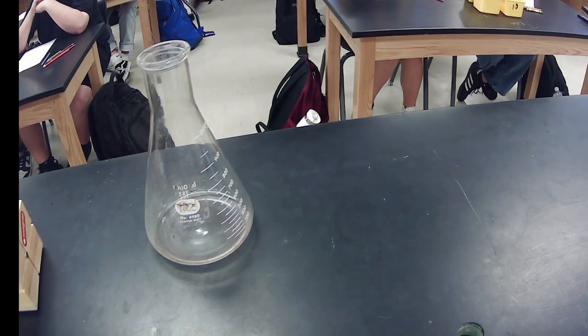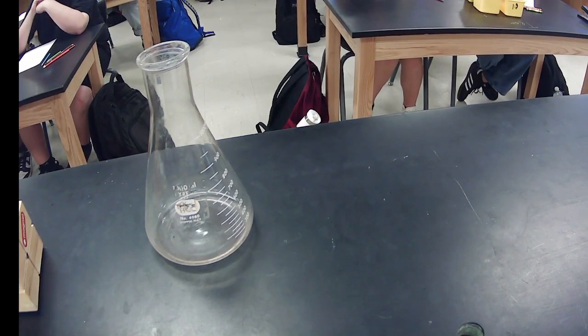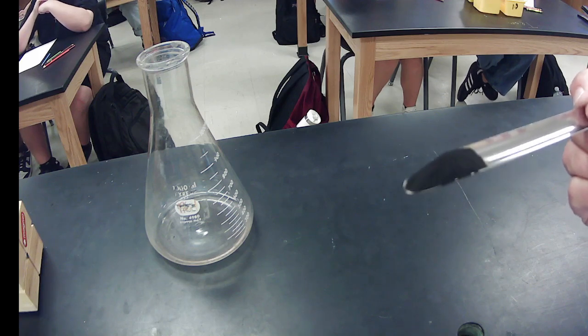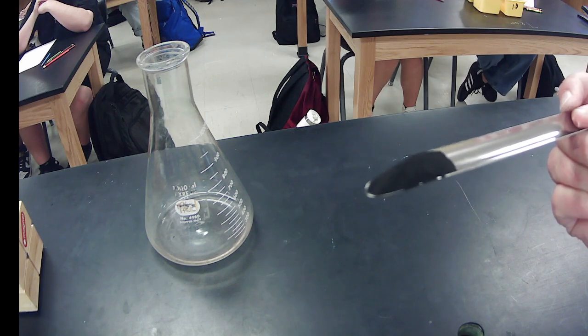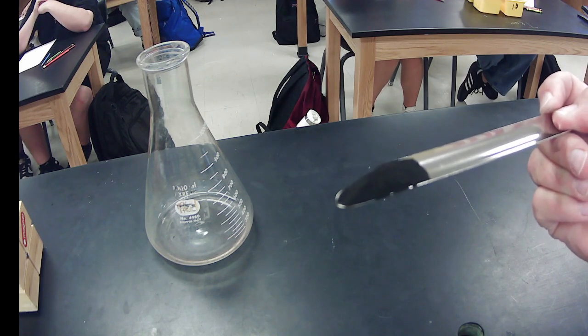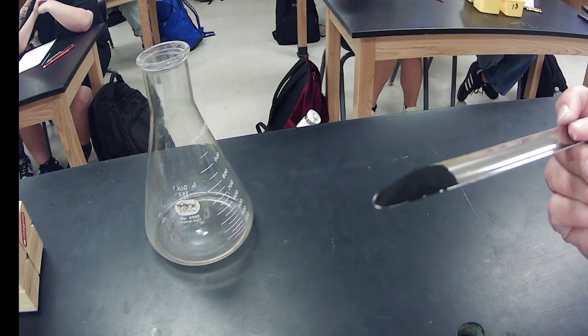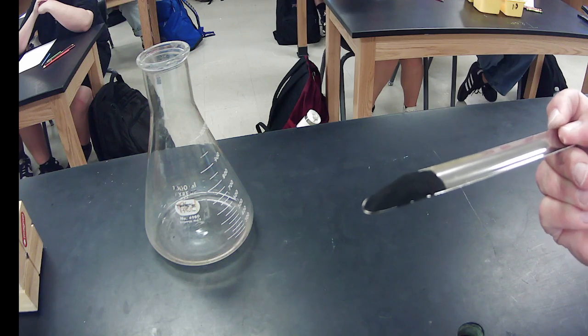All right. Now, this stuff I'm going to show you guys is black, okay? So when we put our manganese dioxide in here, it's just like a black powder. So remember, 2 things a catalyst has to do. Number 1, speed up the reaction, right? Number 2, it must be the same at the end of the reaction as it was at the beginning, which means I need it to go back to being black. Okay? All right.